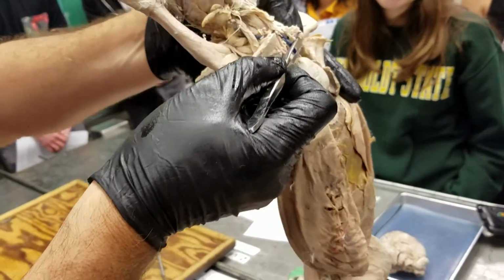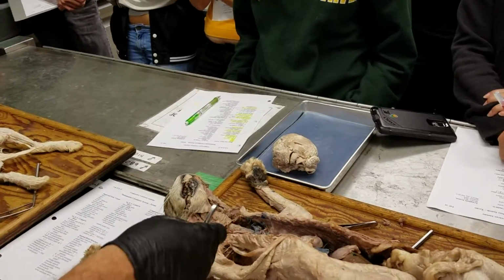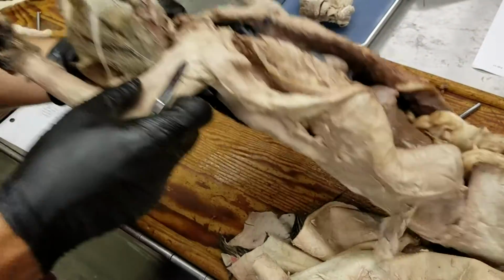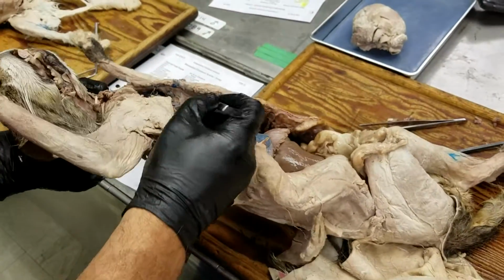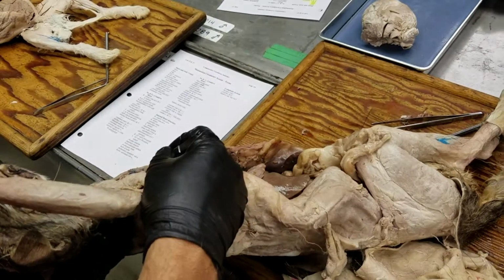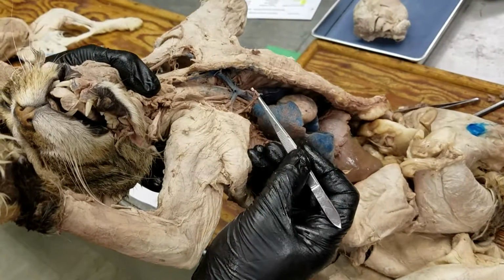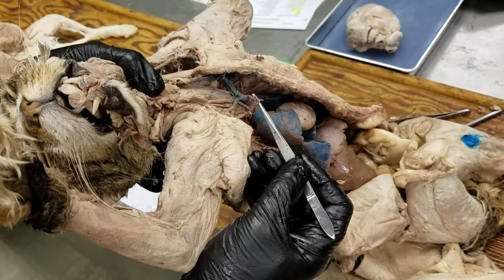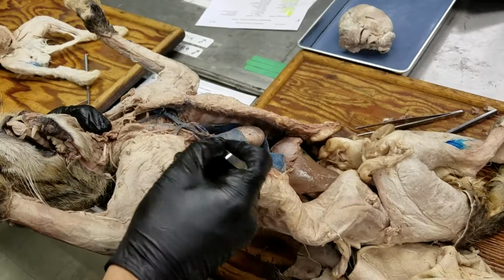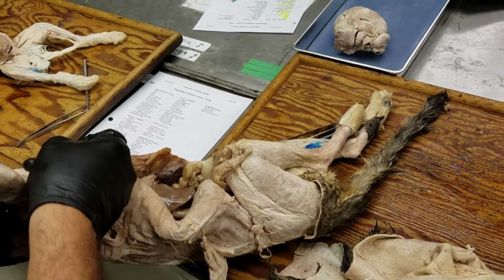vein, okay, here. And in the cat, because they have, well, we haven't really quite gotten to that yet, they have a single cranial vena cava, they have a single midline internal thoracic vein, and that's this one here. Okay. In the rabbit, there's one from each cranial vena cava going to the inside of the chest. And then there's also internal thoracic arteries, which is shown here. That's an internal thoracic artery. Subclavian.